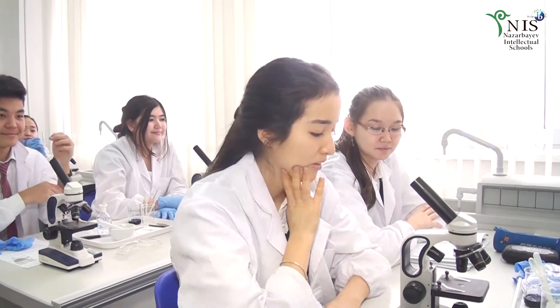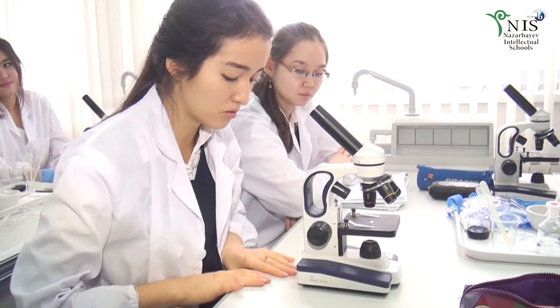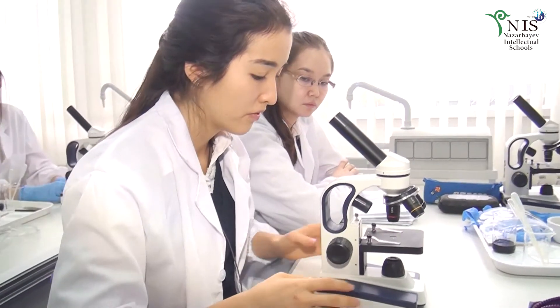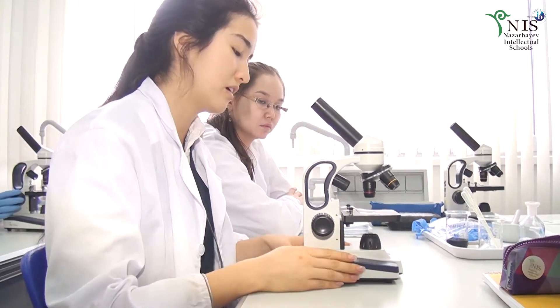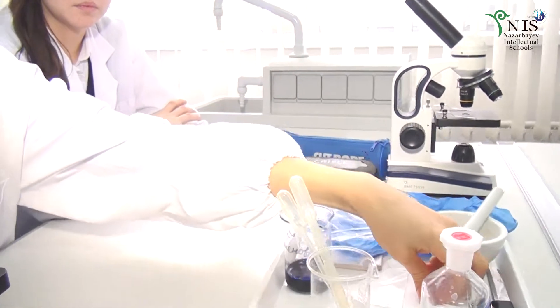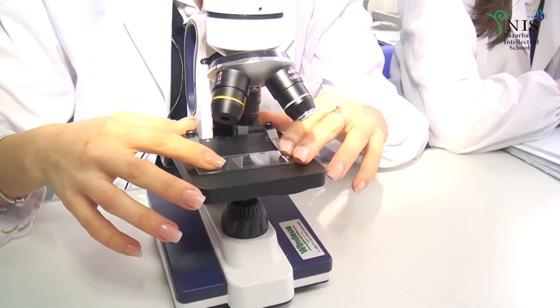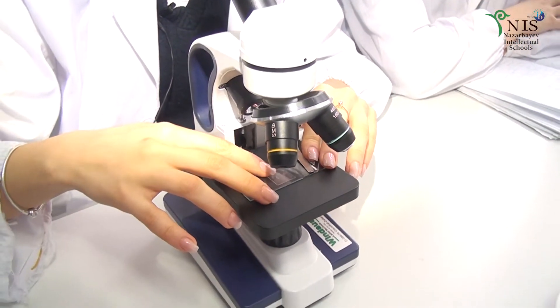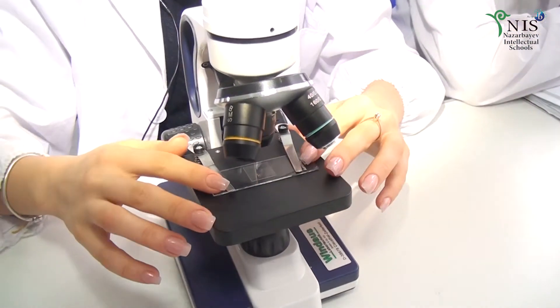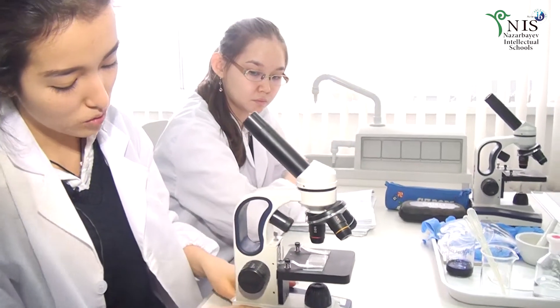Umida, can you describe the steps for how to work with the light microscope? As we started with safety rules, primarily we should place it on the table at a distance from the edge of approximately a finger's length. Afterwards, the microscope is steadily placed. We should prepare the material for investigation on the microscopic glass. Then we place it on the stage of the microscope — the material should be placed right in the center of the ocular, in the center of the hole where the light is coming. We turn on the microscope and make sure the light is on.